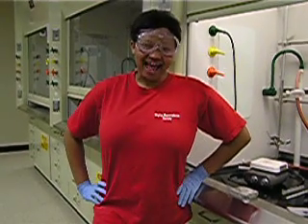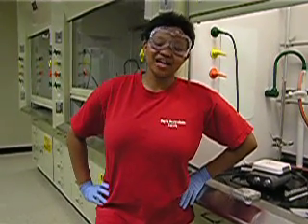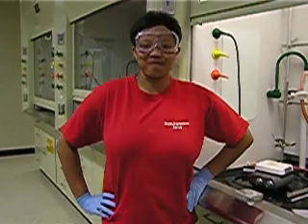Hello, my name is Erica, and today I'm going to show you how to set up and use a fractional distillation apparatus.